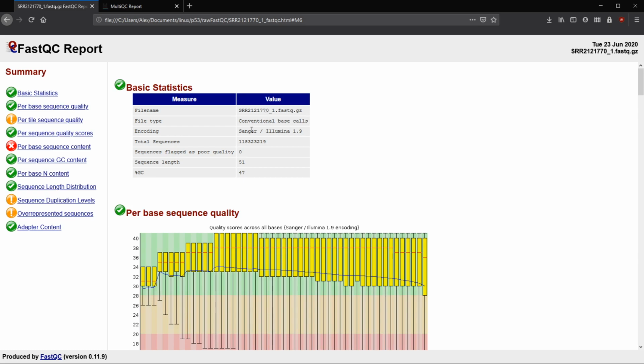File type, just basic. We have Illumina reads. Sanger, I'll mention this a little bit later when we start talking about the per base N content. Sanger always has a really high per base N content at the beginning and the end, because the first 25 are just bad reads. The total sequences that we have for all of the forward is going to be a little over 118 million.